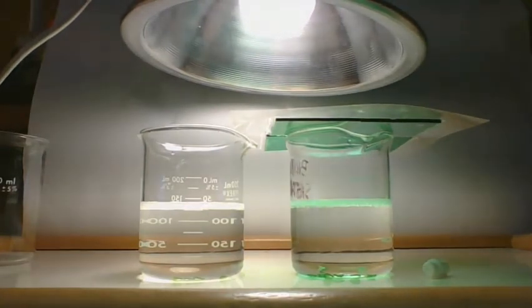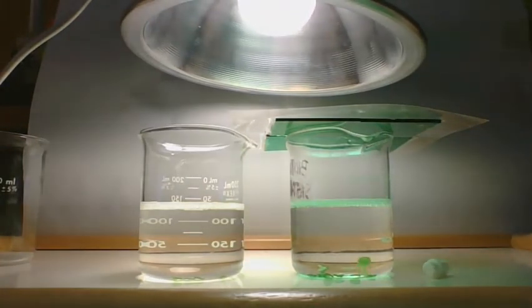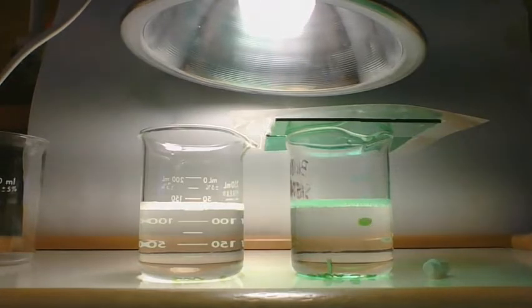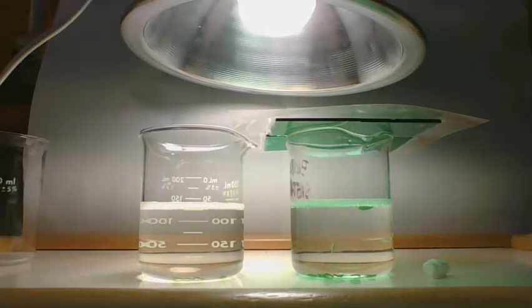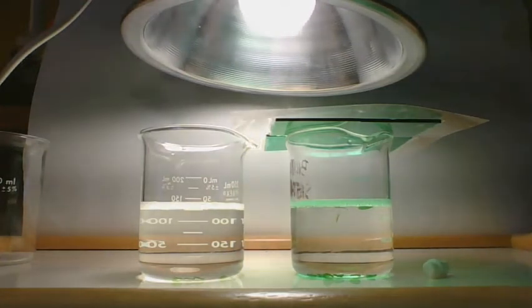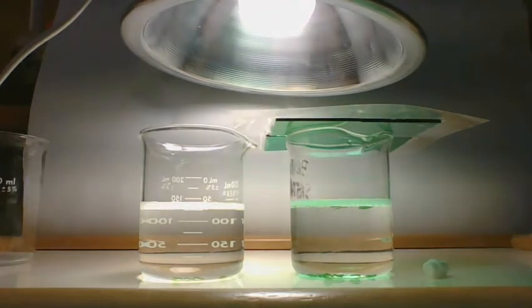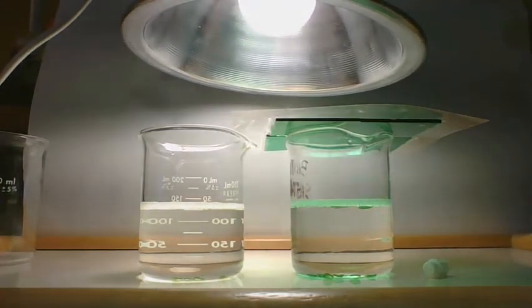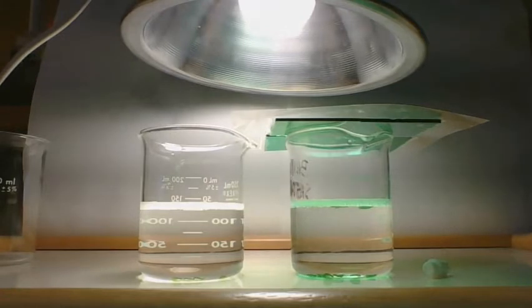If you're paying attention to the bottom, if they're getting ready to float up, you'll see one side of them tip upward. Oh, I see one going up on the green one already, and then you'll see others going up too. What you've got to remember is that if they go up at the very beginning, it might take longer for it to be all 10. I'm going to stop counting at 15 minutes, whether they're all up or not. Just so you guys are aware of that.